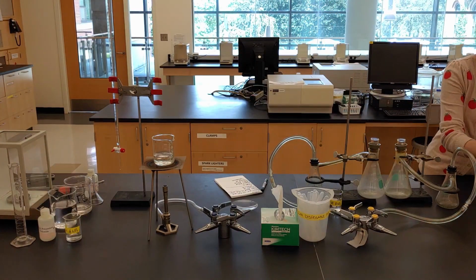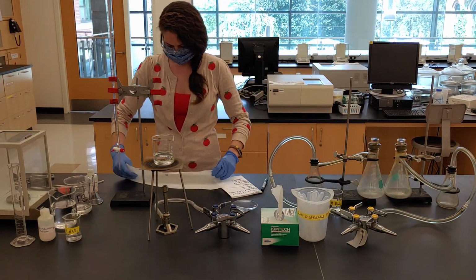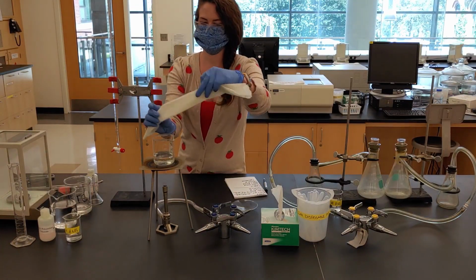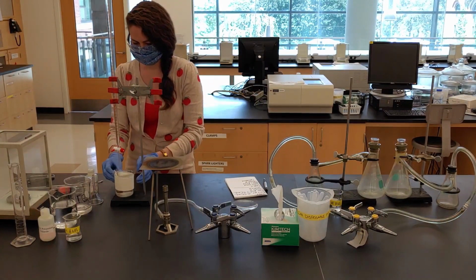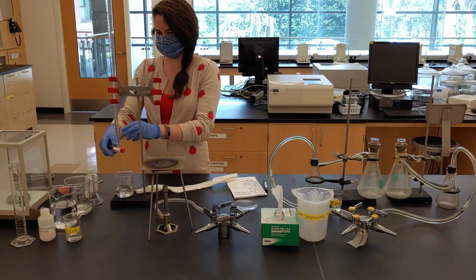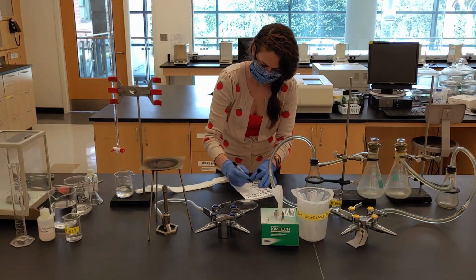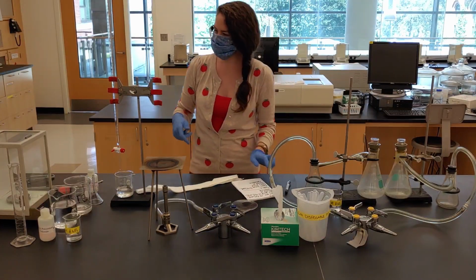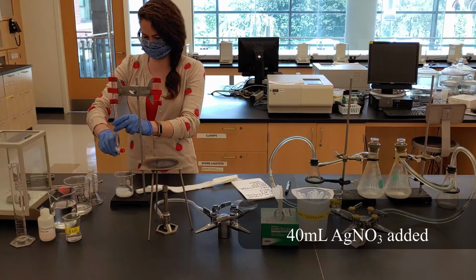Paper towel can be used to lift the hot glassware. Add the second assigned volume of silver nitrate to the beaker.